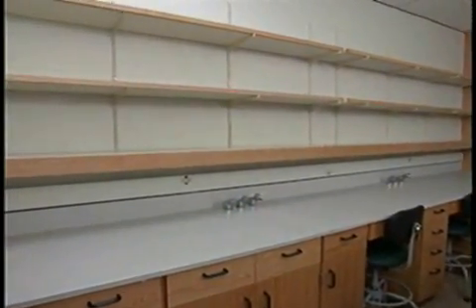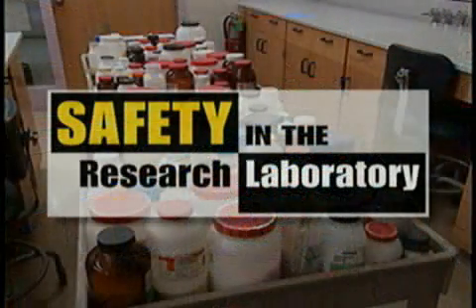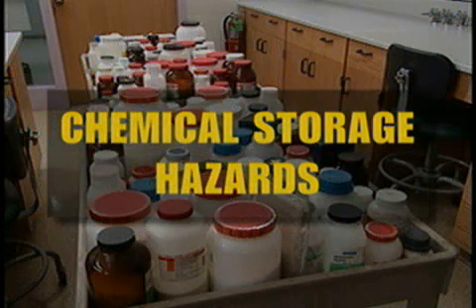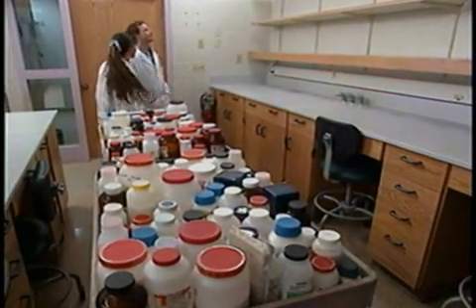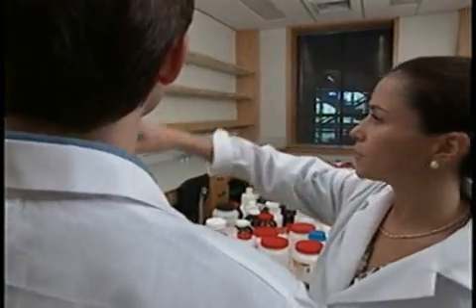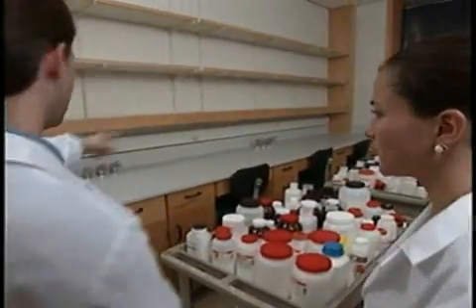Empty laboratory shelves waiting to be filled — yet there's much about the safe storage of chemicals that we've learned but don't quite remember. Suppose, like Dr. Mario Gimona and lab assistant Lisa Manchi, you are just moving into a new lab. It's a chance to put all those chemicals into logical, convenient order and along the way to review the principles of safe storage. How well would you do?